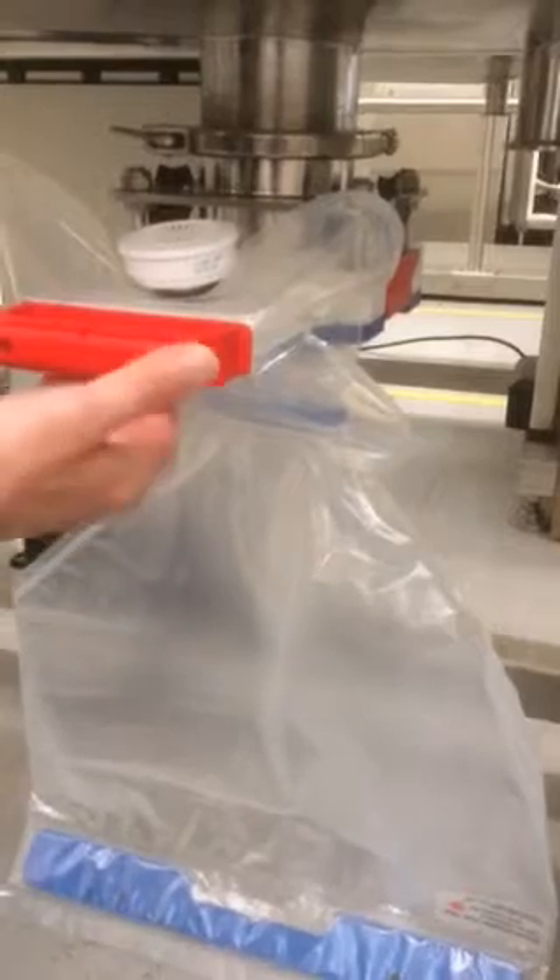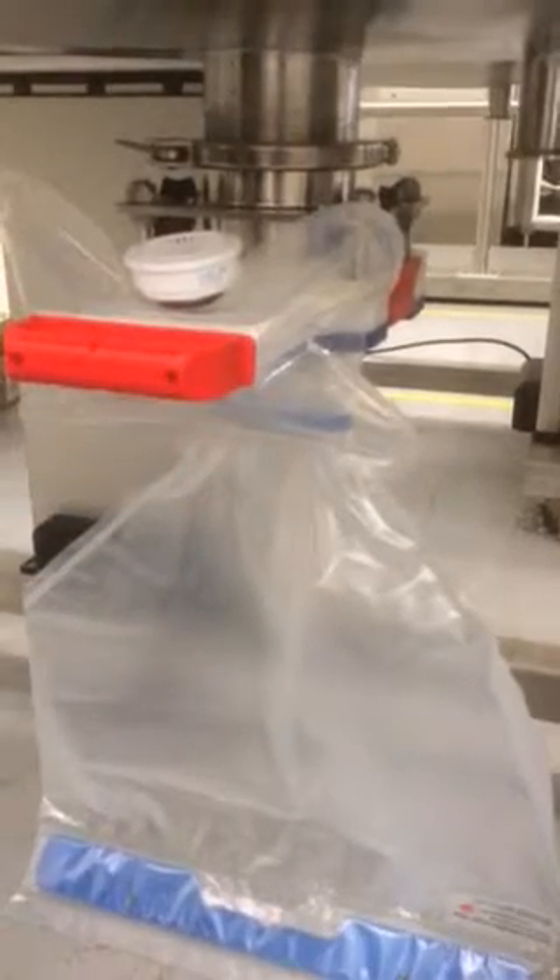So at that point they would have to have the door shut. Yes, of course. So this is through the glove. Now the third step.